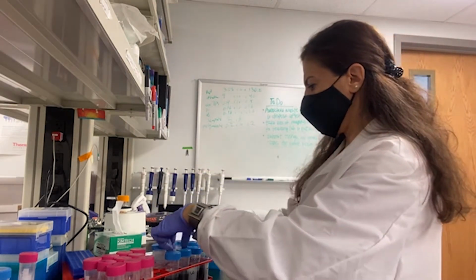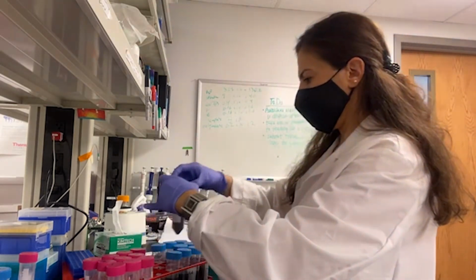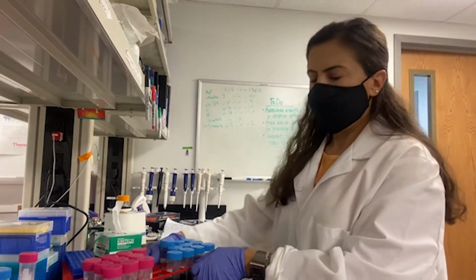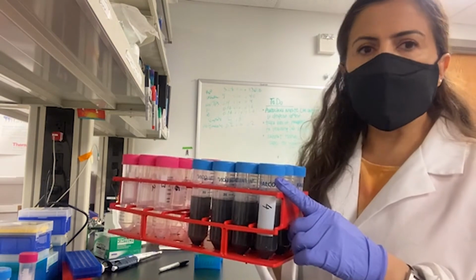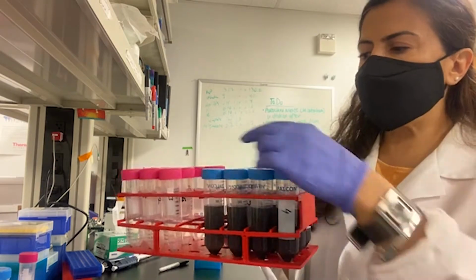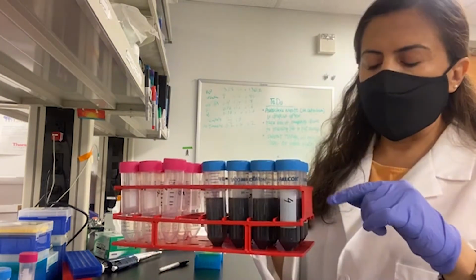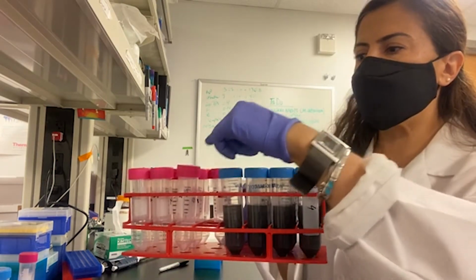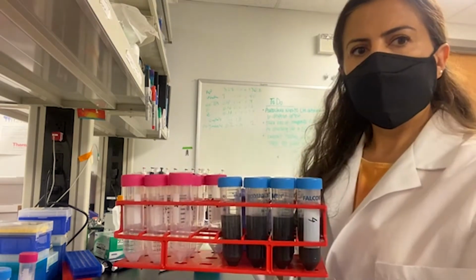So now I added the known quantity of my surrogate virus into my samples, and I'm now going to centrifuge my samples. Now my samples are ready for the centrifugation step. In that step I will be separating solids from the liquid part, because the solids would clog the membrane of these filters. So the first step in my method is centrifugation to separate solids from the liquid, and the liquid is going to be concentrated in this centrifugal ultrafiltration unit. Let's go to the centrifugation.